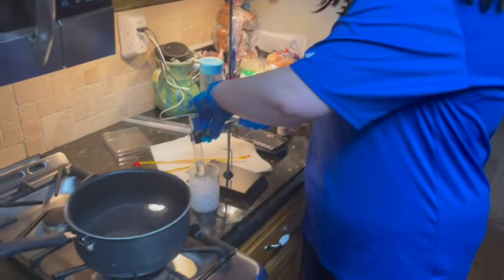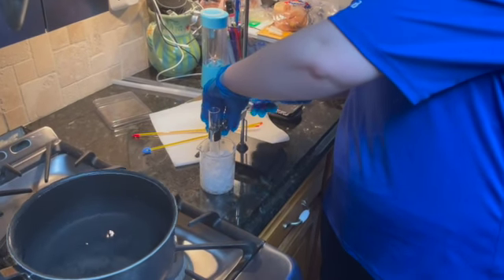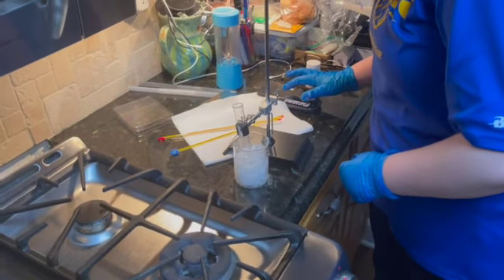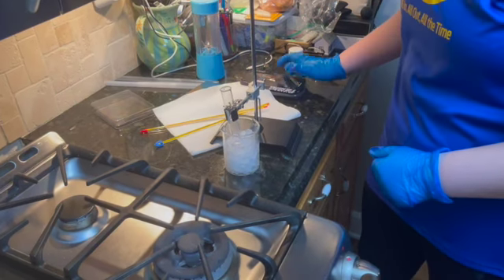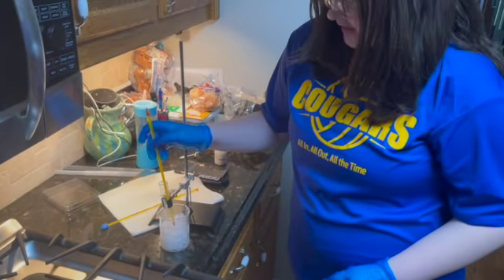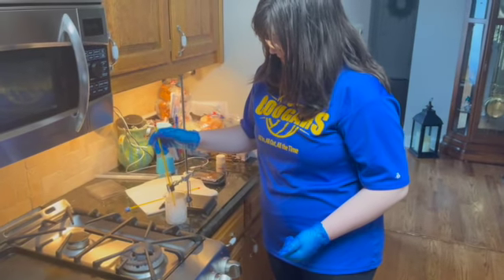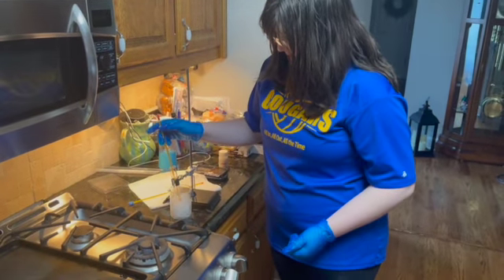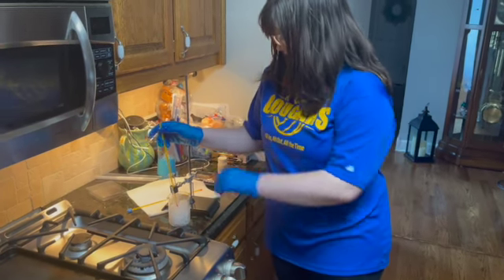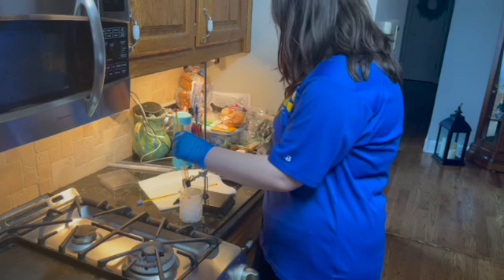Okay, so I am now adding our mixture into the ice bath and tightening the clamp on it so it stays, and beginning our timer. So at the very beginning of this, just looking at it, our mixture with our naphthalene, with our paradichlorobenzene has a temperature of 47 degrees Celsius. So as it's been added to this mixture, it has gone down a good bit.